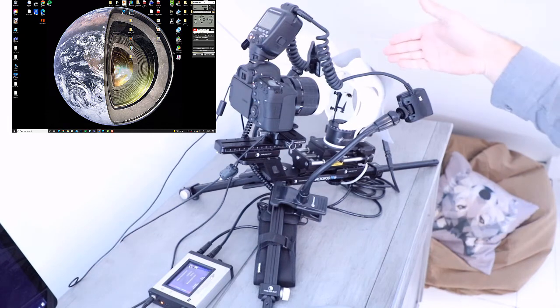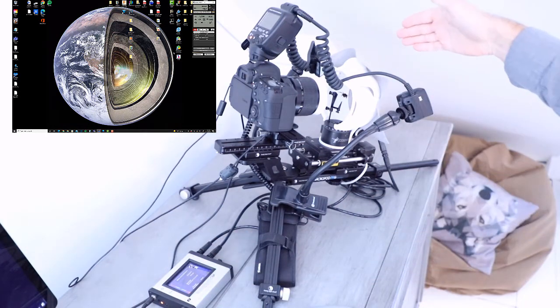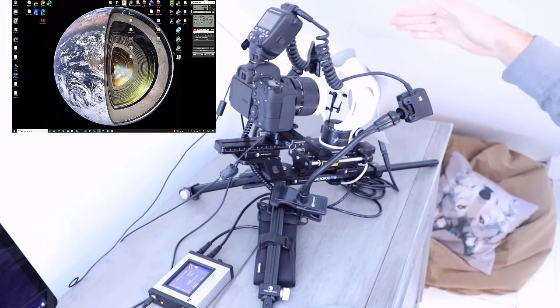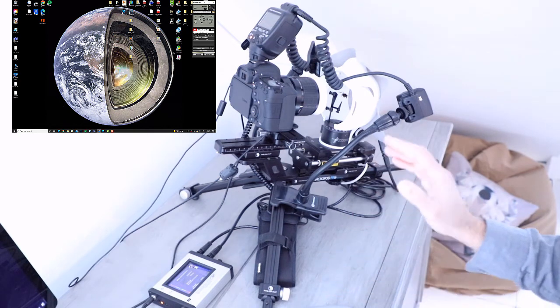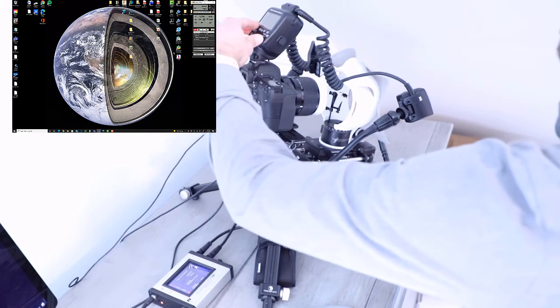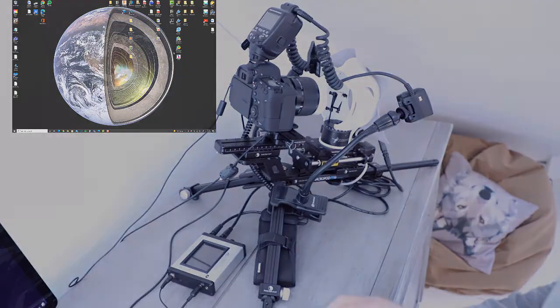And now what it's going to do is it's going to be capturing another 240 degrees around basically the part of the specimen that wasn't recorded previously. So I just wanted to show everybody how to do that. I've already gone ahead yesterday and taken all these images, so what we're going to do now is act like that's all done, and we're going to shut the system down, and we're going to turn to the computer, and everything else is going to be done there.